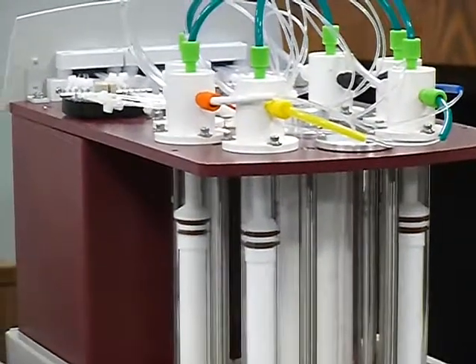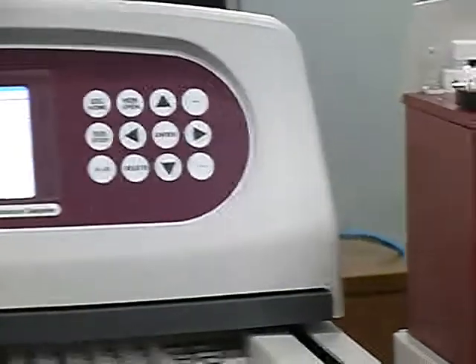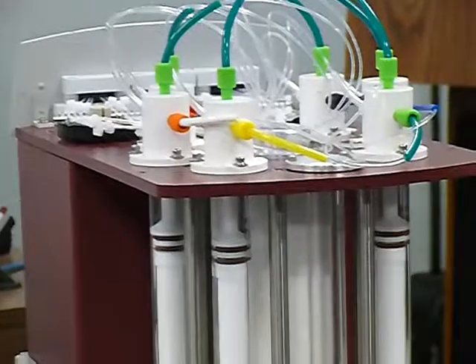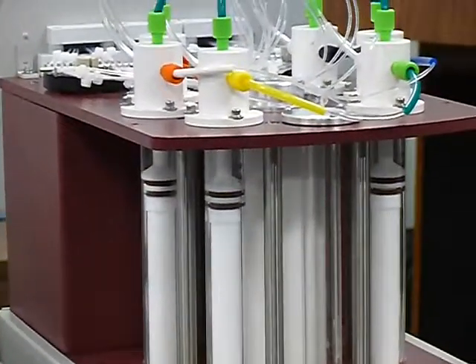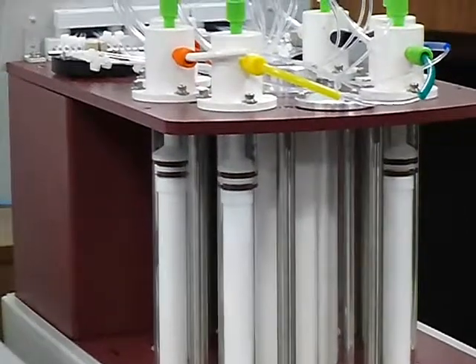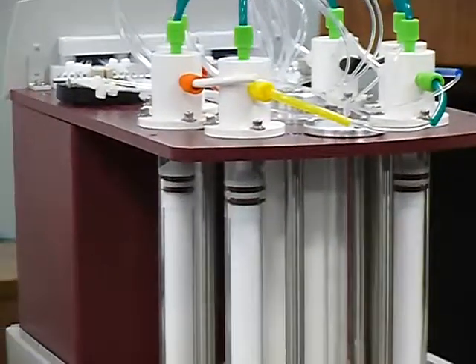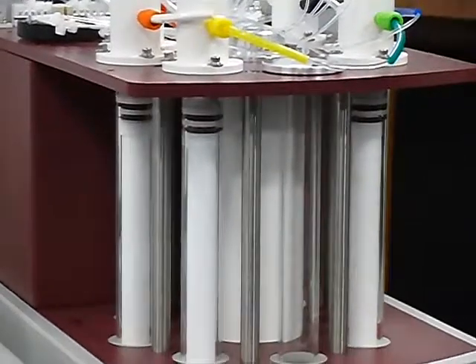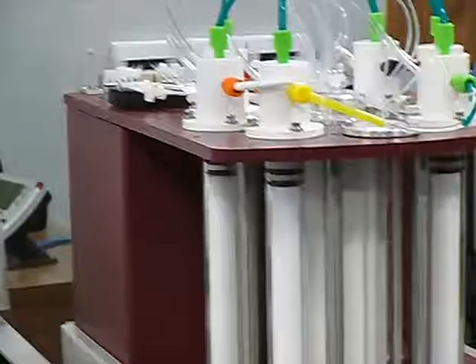Those that are running the vials, they really just want enough to put on LC, that their LC needle is going to be able to go down there and grab its 5 to 20 microliters for an injection. But if they want that fast of a time every 5 minutes, then they've got to sacrifice something to get that 5, and that means it's going to have to run faster. If it runs faster, you also want to cut off some of that offset time. Instead of 3.5, bring it down to 2.5, and watch how that number goes down.